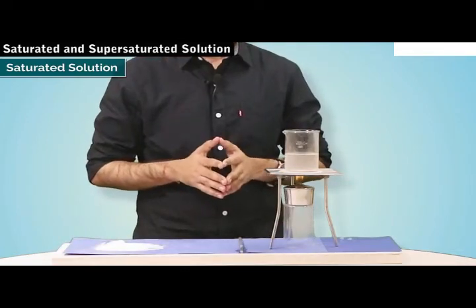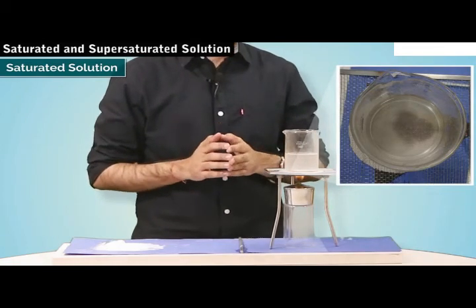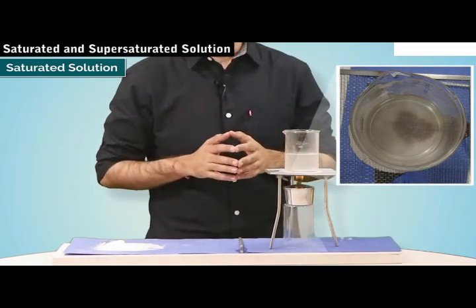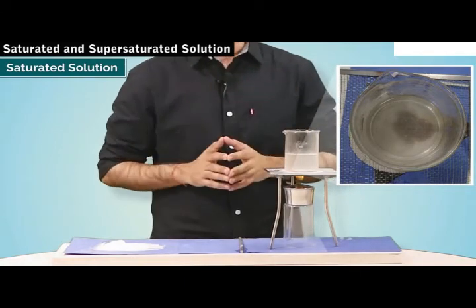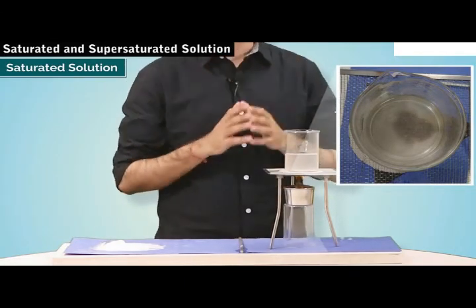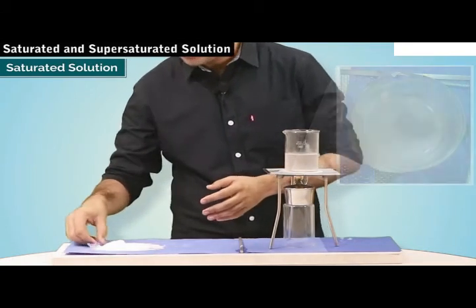So what can you observe here? Can you see that the undissolved salt, which was initially settled at the bottom of the beaker, has started to dissolve now? And at this point of time, even if we add more salt, it will dissolve. Let's try it out.